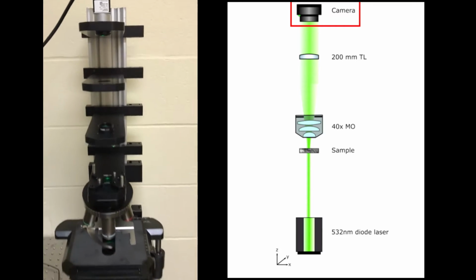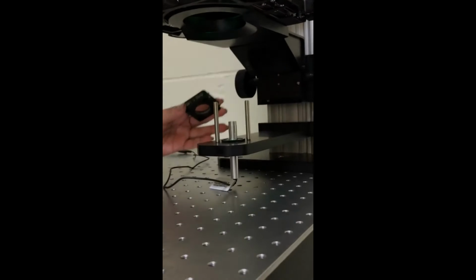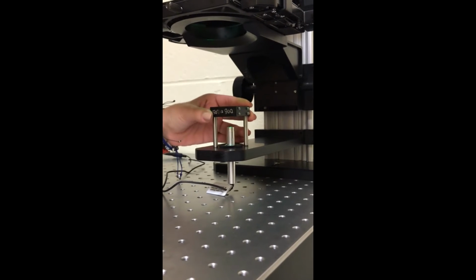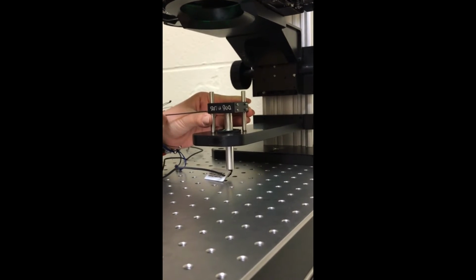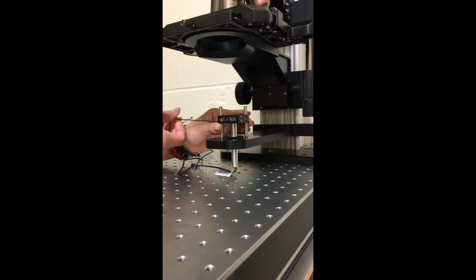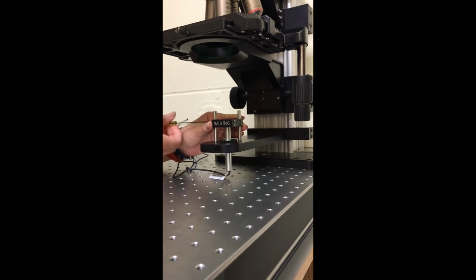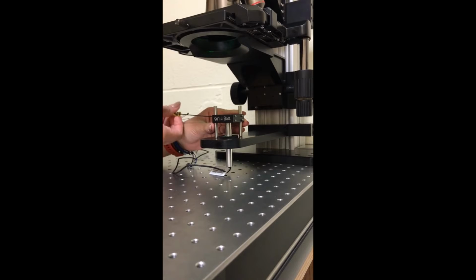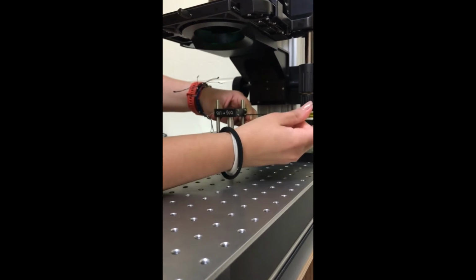To convert the optical microscope into a polarization-sensitive system, it is necessary to add extra optical elements. In our case, the laser used is elliptically polarized, so at the exit of it, we place a depolarizer to have randomly polarized light.